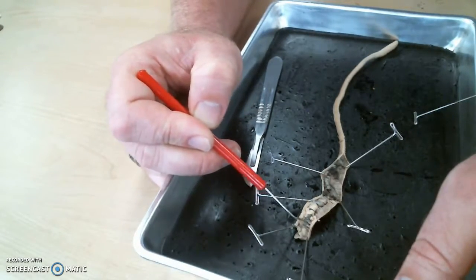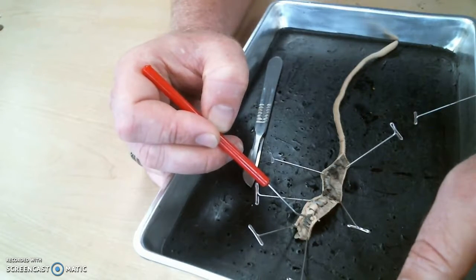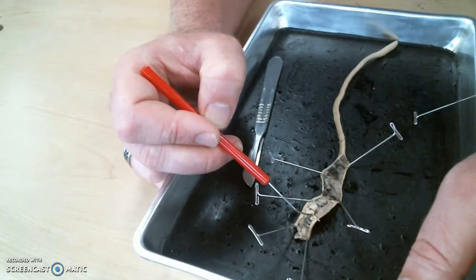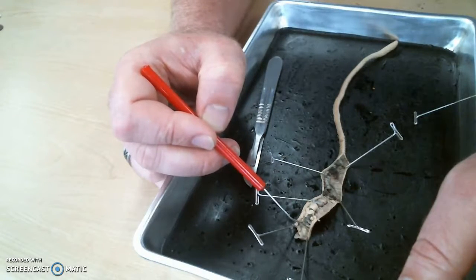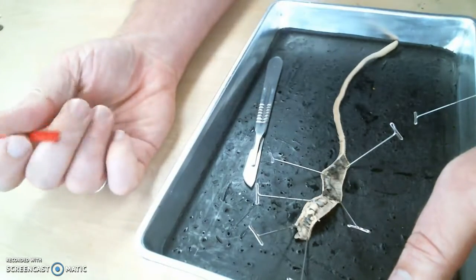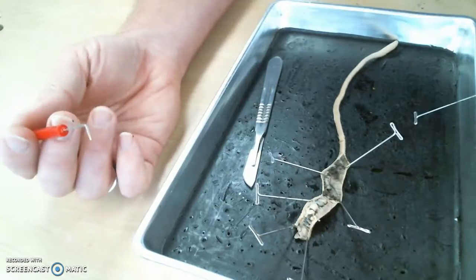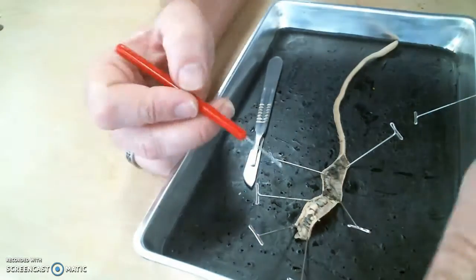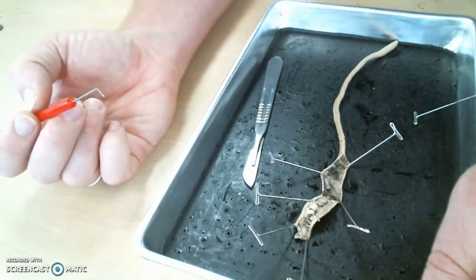Okay. Speaking of circulation, the dorsal and the ventral blood vessels meet up here. And there are 5 arches that join the dorsal and the ventral. And you can see one of them here and one of them here. You can see another one right there. If I were to very carefully tease all this other little tissue off around it, you would see that there are 5. What are those 5 loops called? Aortic arches, and they serve the same purpose as the heart in you. So some people say they're hearts. More properly, they are called aortic arches.